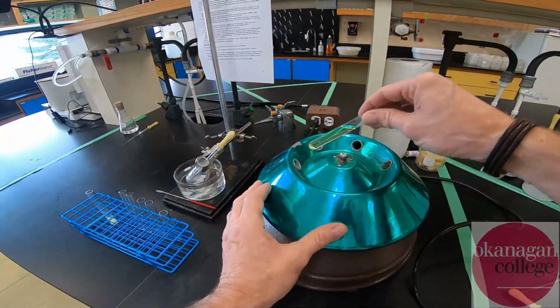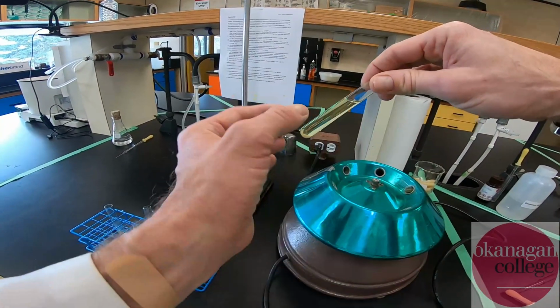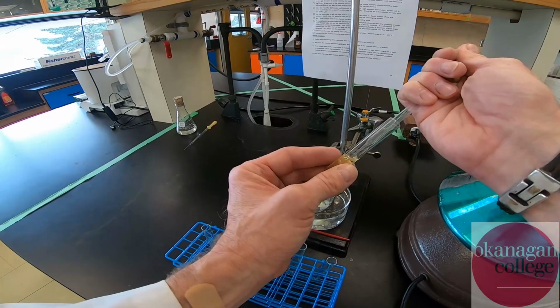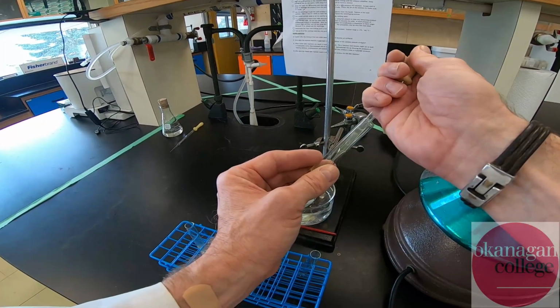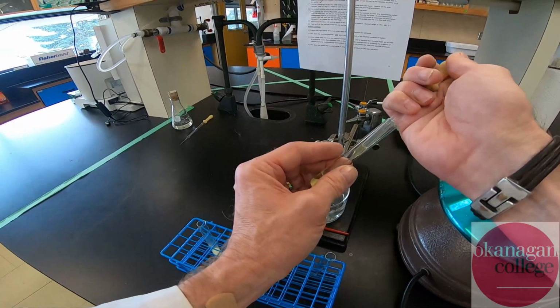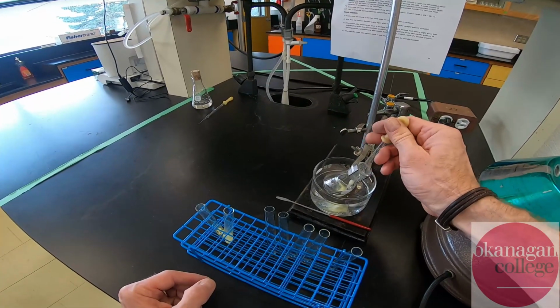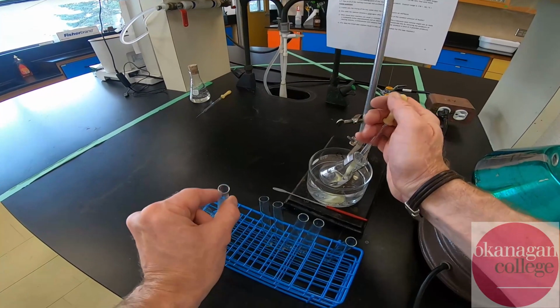Okay, so we ran it down for a few seconds and you can see things settle out quite nicely. We've got our solid material here, and I'm just going to use that clear liquid above it to help transfer that last little bit of solid into other test tubes. If I were just to use more and more solvent, you would eventually dissolve more of your material. So you're actually chasing your tail again, because you're doing extra work to transfer material over, but in fact only making things worse because you are dissolving more material than you're actually transferring over. So I'm going to do this a few more times to hopefully transfer over the last bit of material.